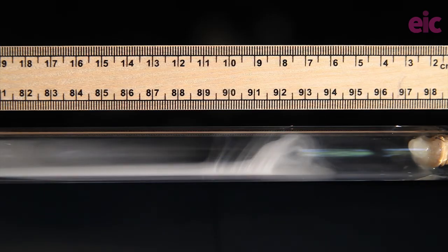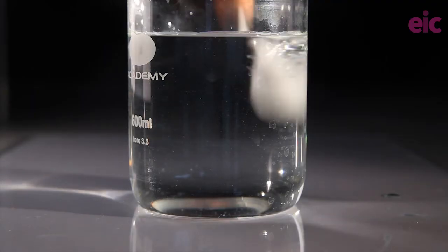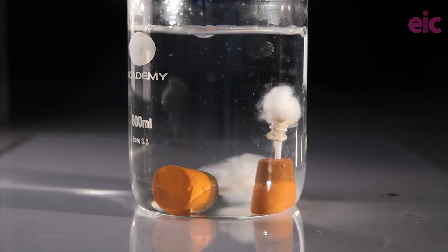Once you finish the experiment the bungs can be dumped into a beaker of water to dilute and neutralise the remaining chemicals before washing down the sink. It's always worth revisiting those classic or easy demos that you've just always done this way especially for updated health and safety guidance.